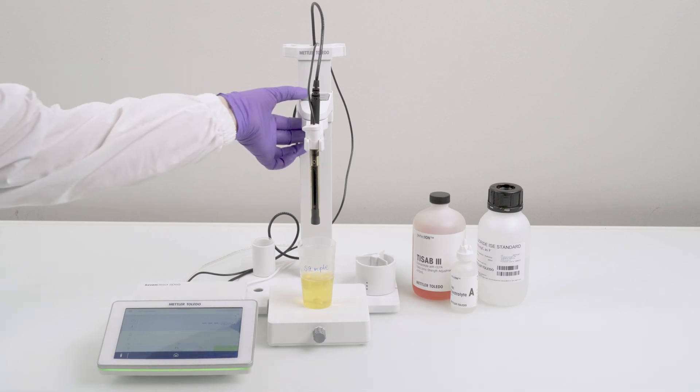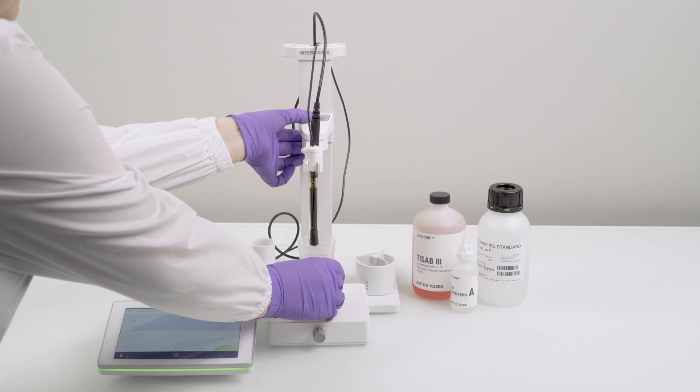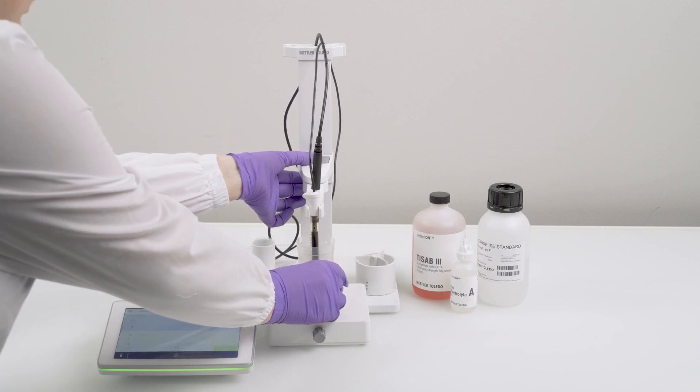Next, immerse the electrode and the temperature probe in the sample and ensure that the electrolyte level is above the sample level.